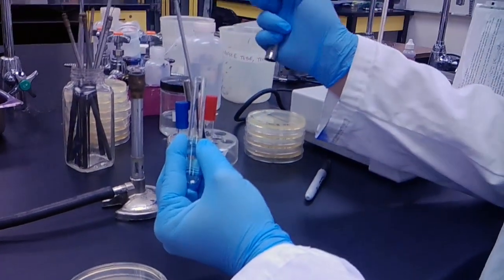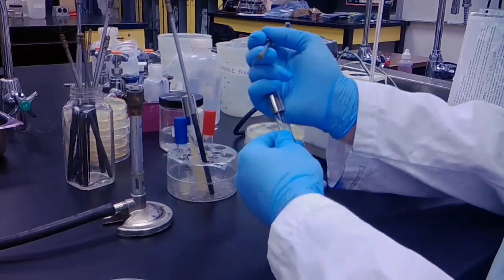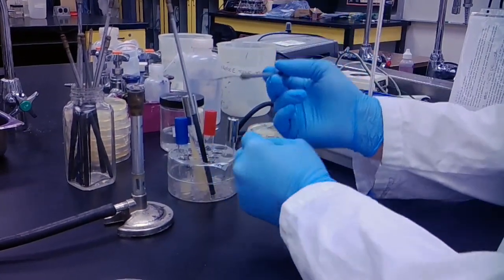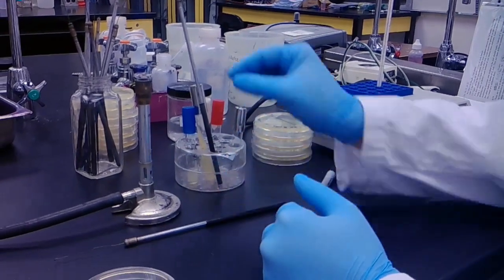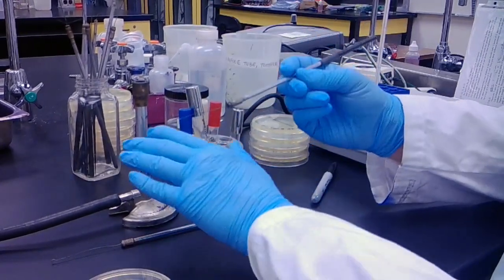And then flame my loop as always. Next, as I mentioned prior, I'm using a different kind of loop.